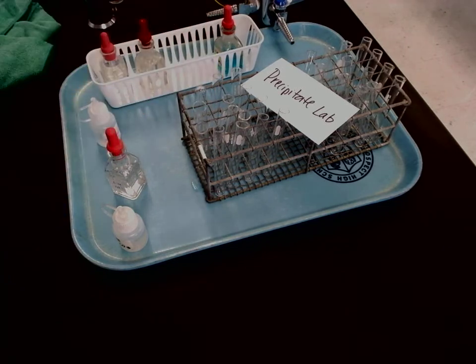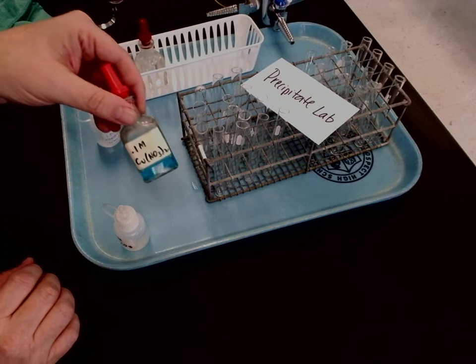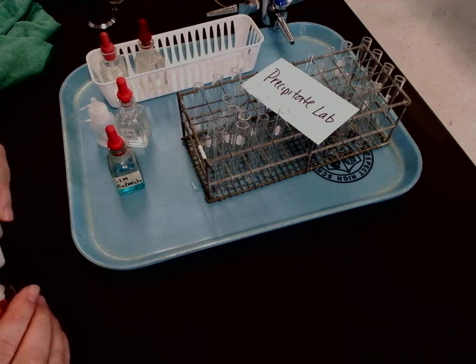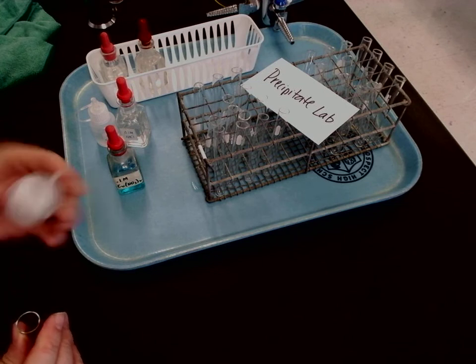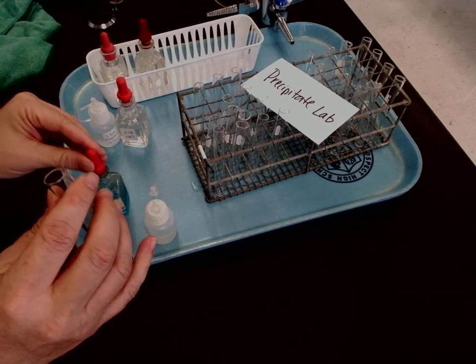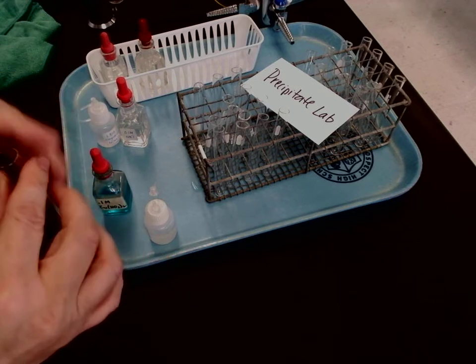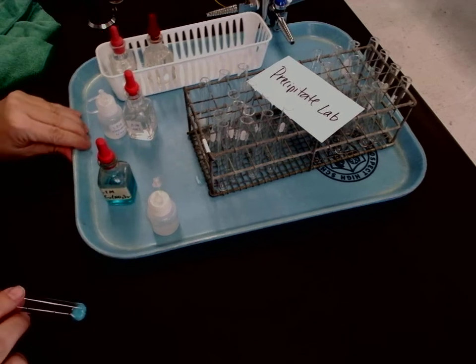The second one, going from left to right, I'm going to be using sodium carbonate with copper nitrate. So here's the sodium carbonate, and here's the copper nitrate — copper nitrate has a pretty blue color. It's kind of hard to see in the camera, let me see if I can get a better angle.